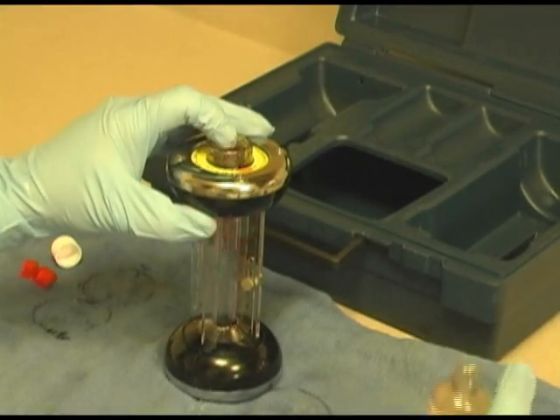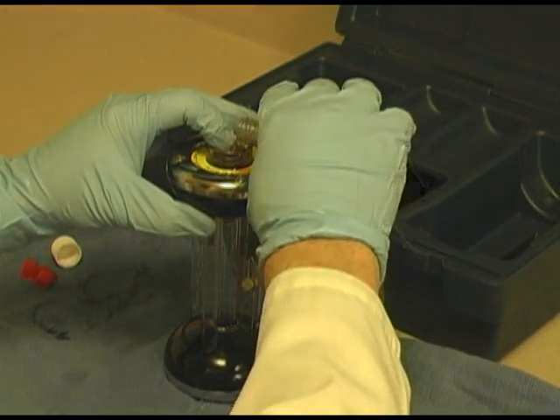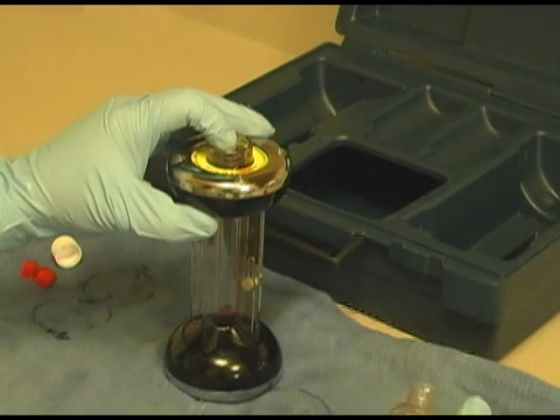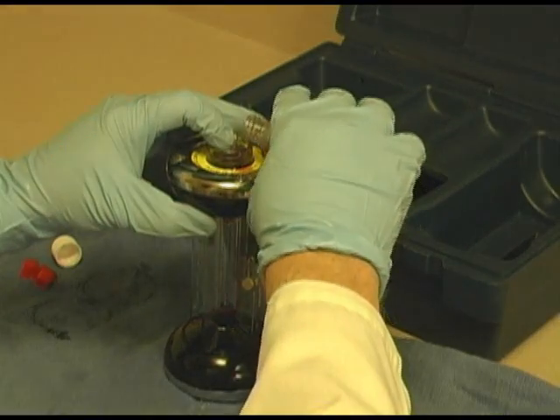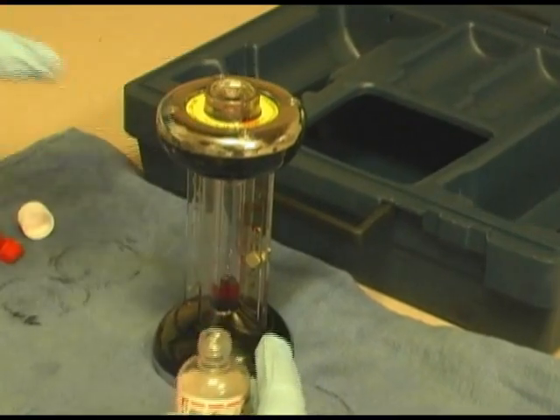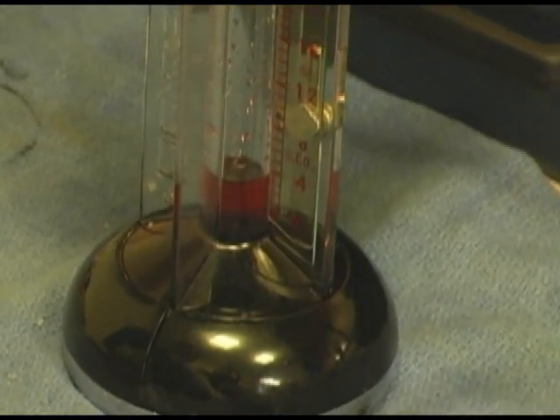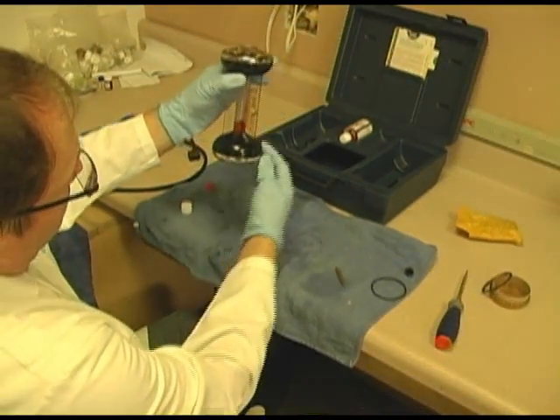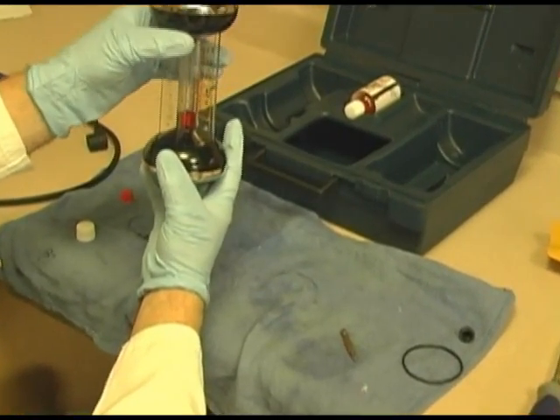And by the way, if you run out of Fyrite, or if you start getting low, you just put a couple drops of distilled water in it. It won't hurt it at all. And that looks about right for me. A tad more. It's easier. I have a tendency to overdo, not underdo. Alright, now of course you can see that I've got enough range so when I zero it that I can go up and put my zero where zero needs to be.